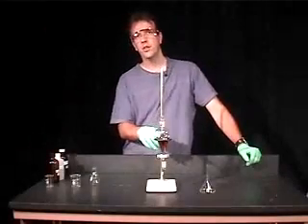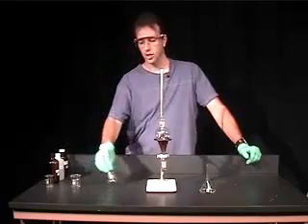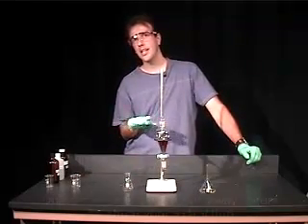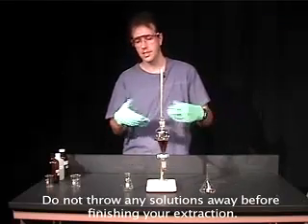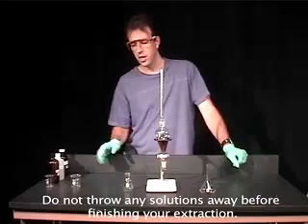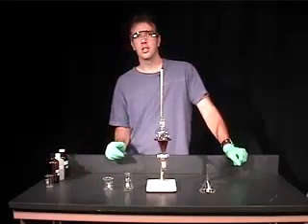One of the first rules of extraction is that when you collect your aqueous layer and your organic layer, you never want to throw any solutions away until you've isolated your, in this case, caffeine, but whatever material you're extracting. So don't throw any solutions away, and then you can continue with the extraction.